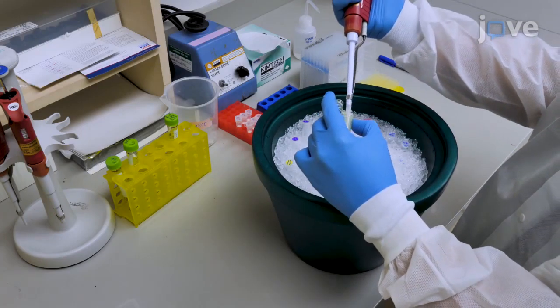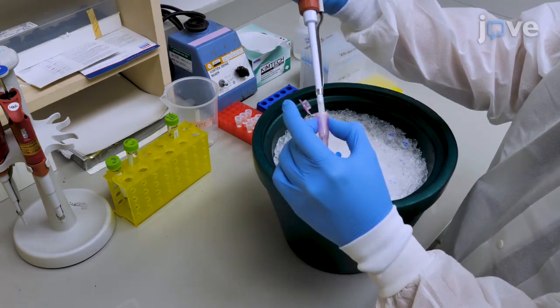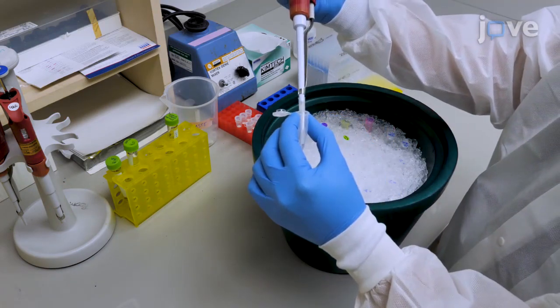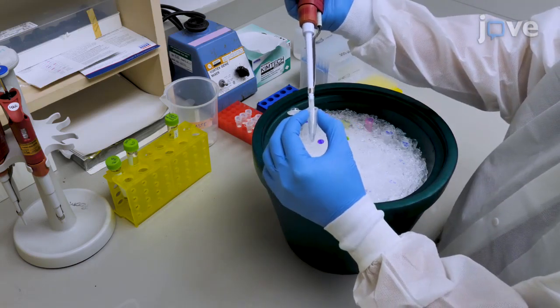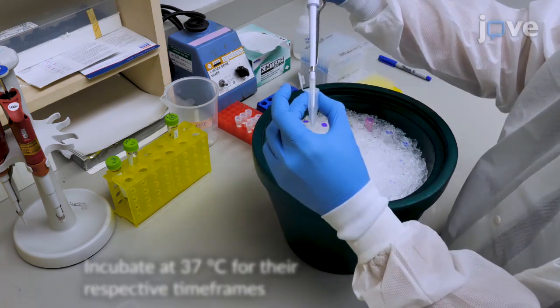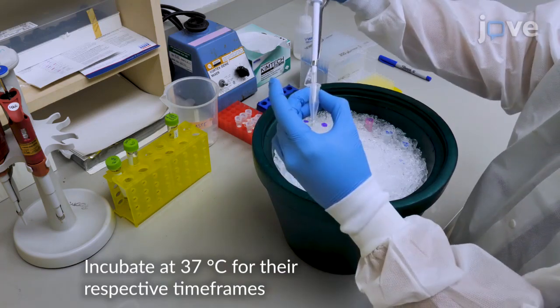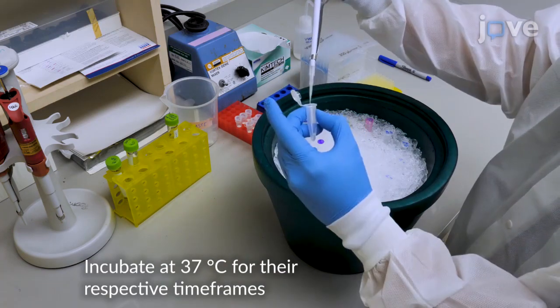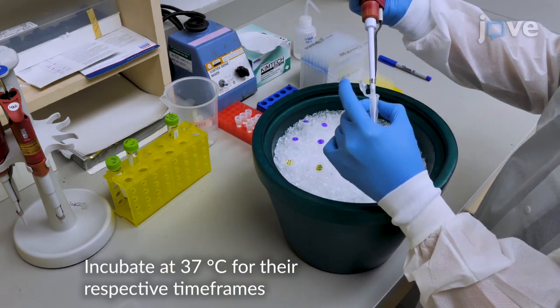Begin by combining the different components in 1.5 milliliter microcentrifuge tubes to prepare final reactions with 4.5 milligrams per milliliter of total lysate protein. Prepare cell-free metabolic engineering or CFME reactions with final volumes of 50 microliters in triplicate per time point.